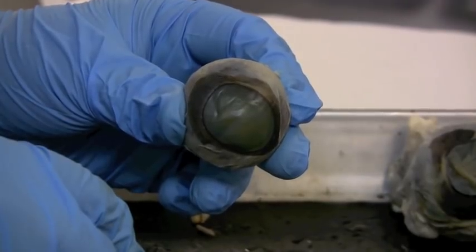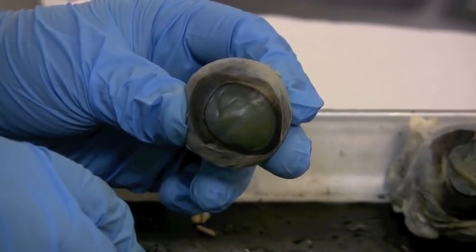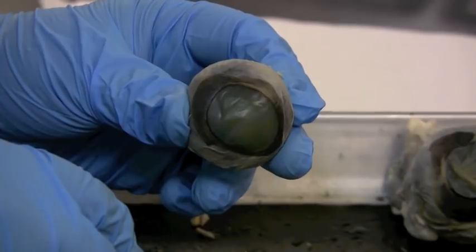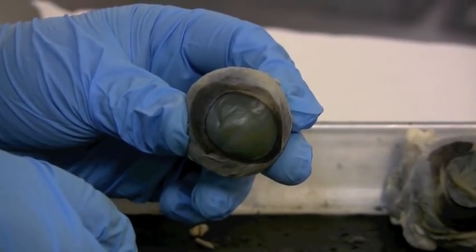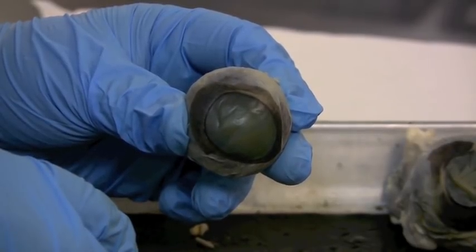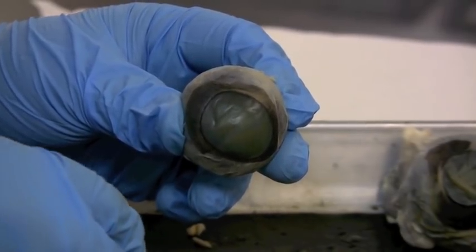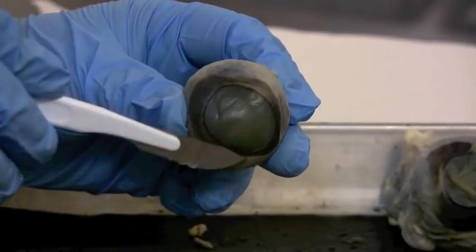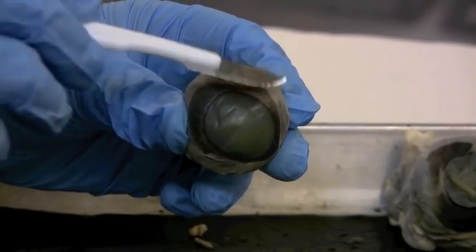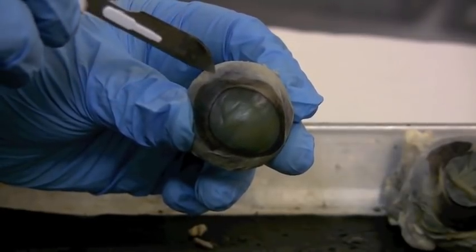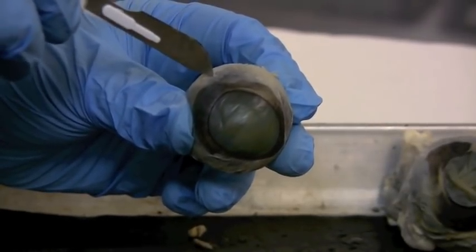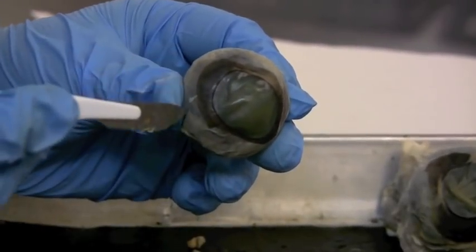Now to cut into the eyeball, it's going to be kind of tough at first because remember we have the different layers of the eyeball. The outer layer is the sclera or the fibrous tunic, and that is going to be very tough and fibrous. So the cornea is continuous with the sclera, we consider that the white of the eyeball. I'm going to cut to the outside right around here so that we can cut a circle all the way around.